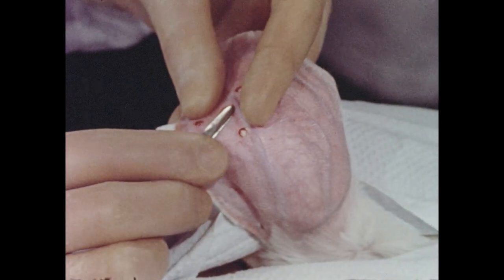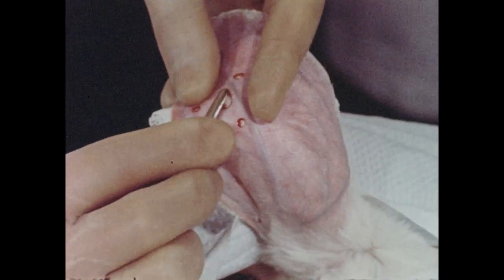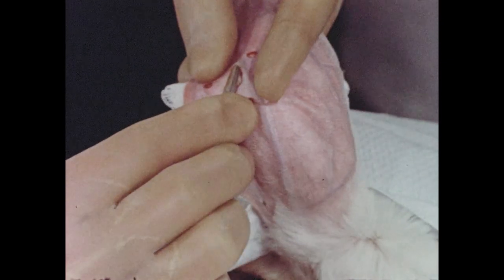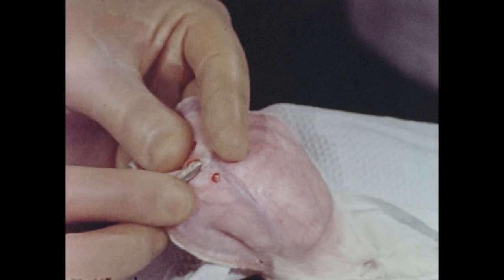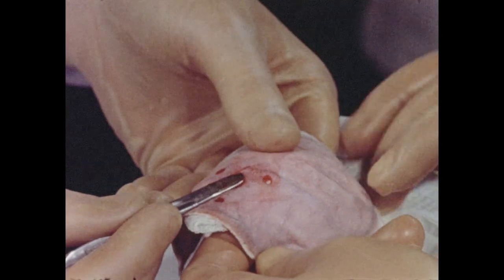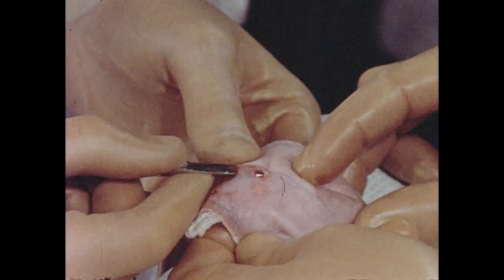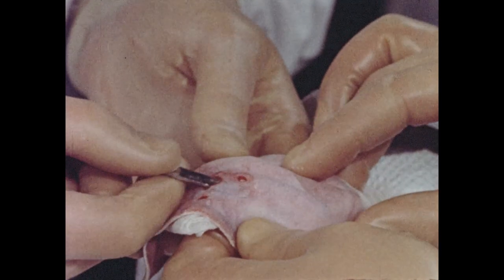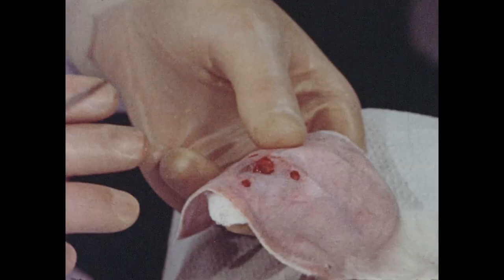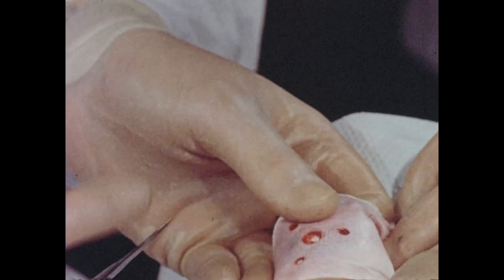By blunt dissection, the skin is carefully separated from the outer portion of the ear. In our experience, most important is the preservation of the cartilage and major blood vessels, particularly the central artery and vein, the marginal vein, and their adjacent vessels. The skin dissection is extended laterally so that a circular area measuring approximately 30 millimeters in diameter is freed. This dissection will be easier and more consistently successful if rabbits having ears measuring at least five inches in length are employed, such as a hybrid between the Flemish Giant and the New Zealand strain.